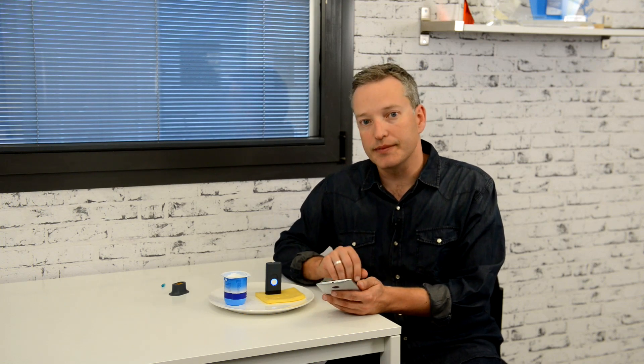Note that if a sample has different parts to it — for example, the cheese itself versus its crust or coating — the insights you get are for whatever you specifically scanned, so make sure you're scanning the right parts.